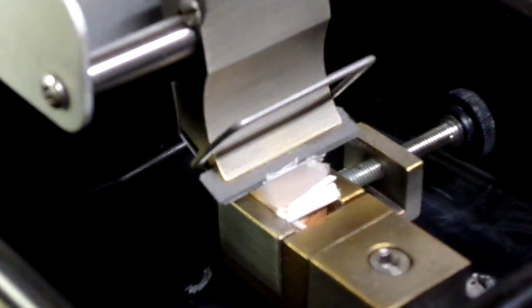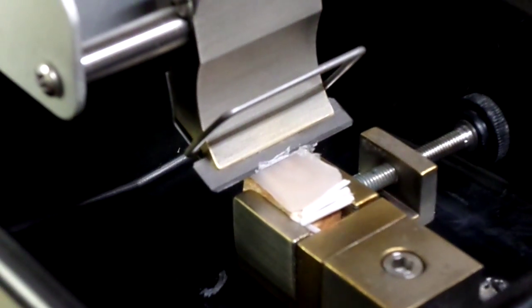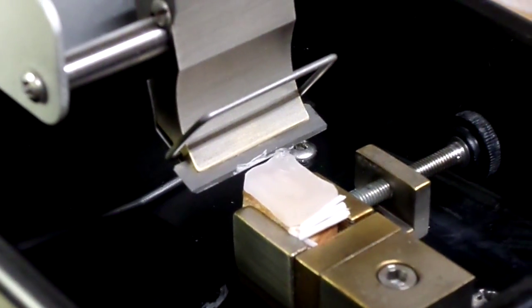You can see it catching a little bit, that's because it's wax and it doesn't go exactly flat with this type of cutting.